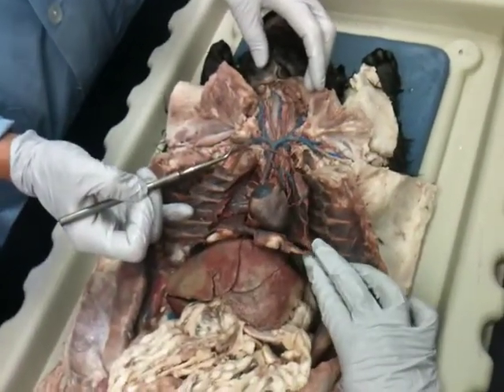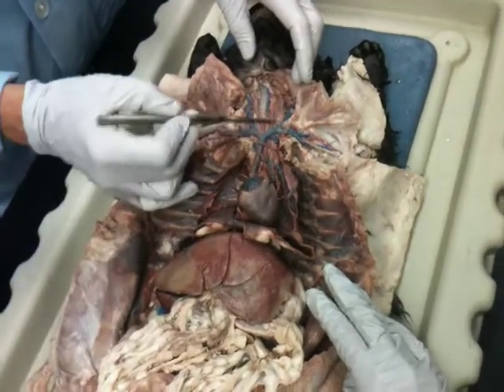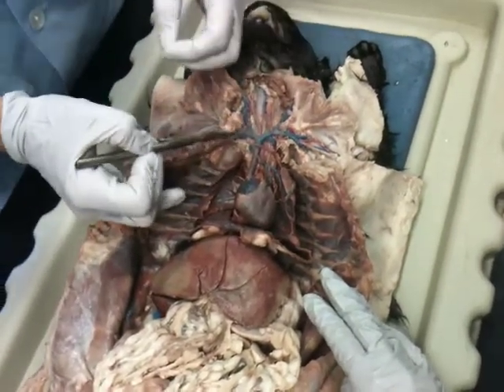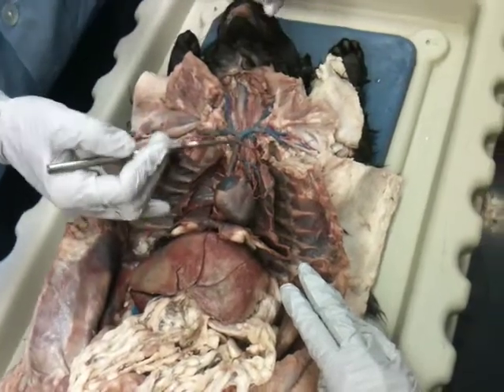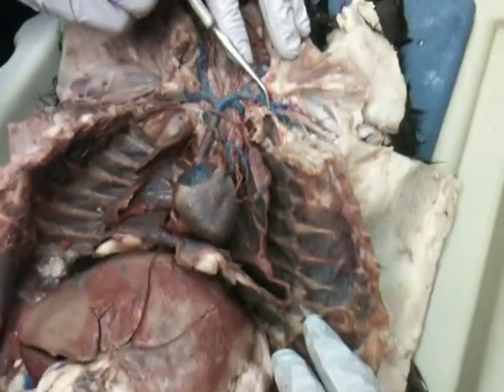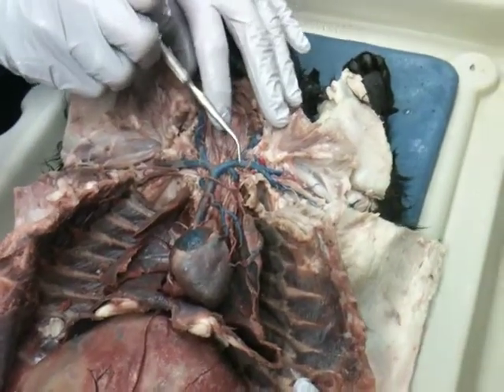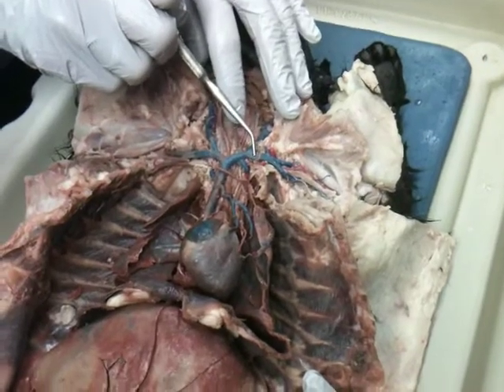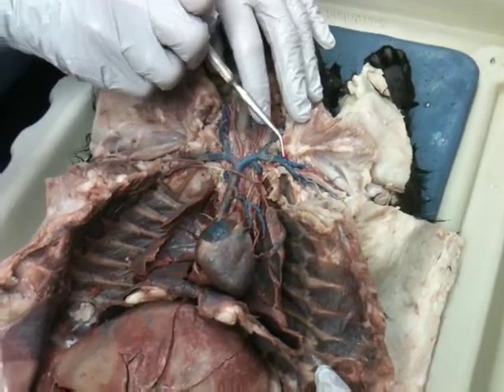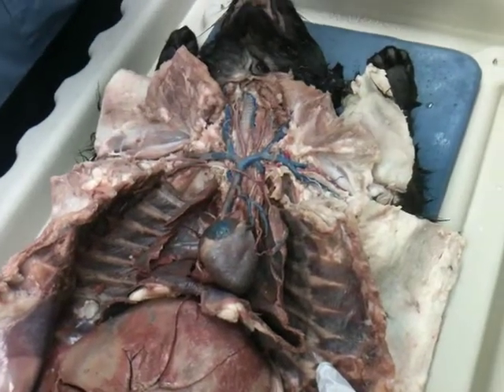Subclavian, is there a branch there that differentiates them? They're pretty much the same, it's just a matter of which one's medial or lateral. If it's closer to the division, it would be the axillary. If it's closer to this area, the subclavian. There's probably particular areas that really differentiate it. I'm not exactly sure what those are.